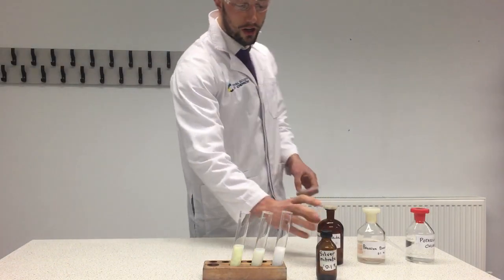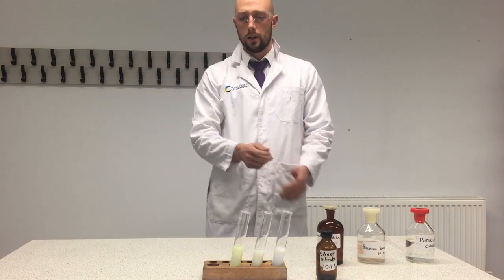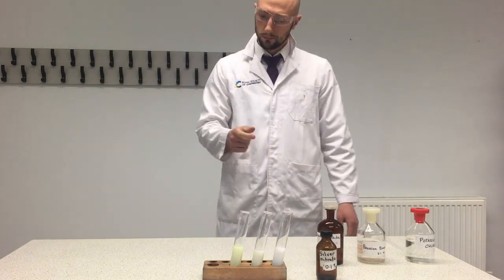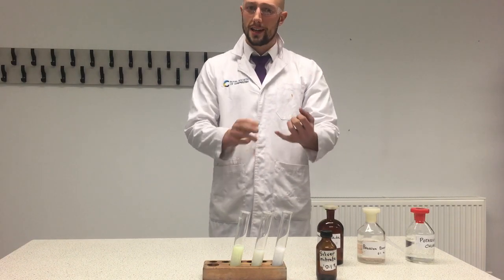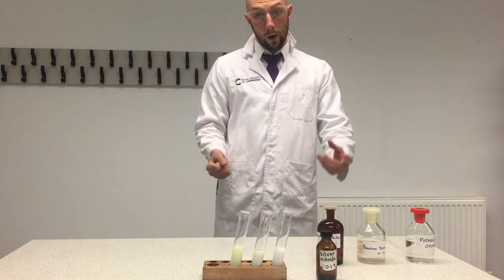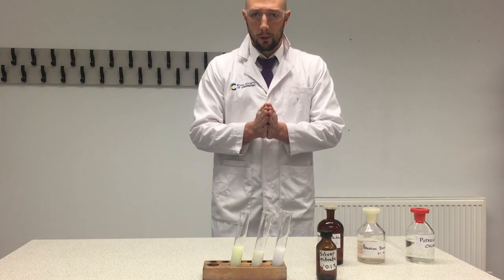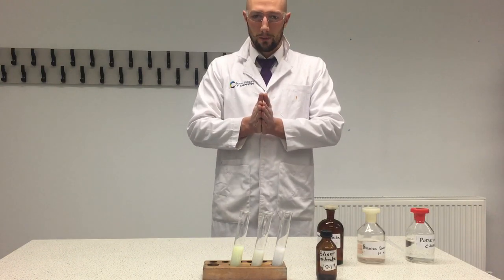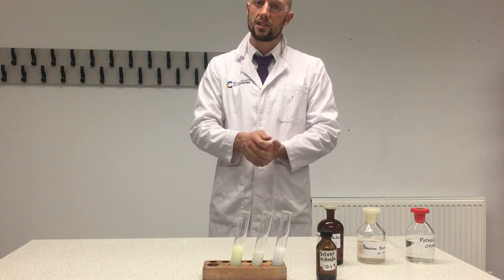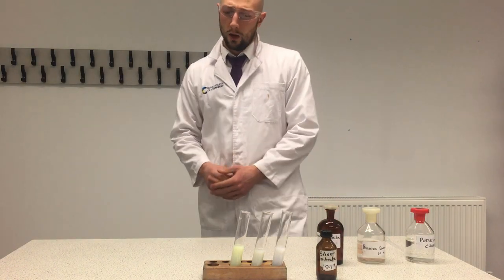So we've seen a progression in color from white to cream to yellow. A precipitate tells us that an insoluble substance is forming within the solution. In each case, we've got a solution containing silver cations and nitrate anions, and another containing potassium cations and halide anions. When the silver cations and halide anions come together, they form a solid because the silver halides are insoluble — the ionic bond forming in a silver halide is too strong for water to break apart — so we form a precipitate, a solid that forms in solution.